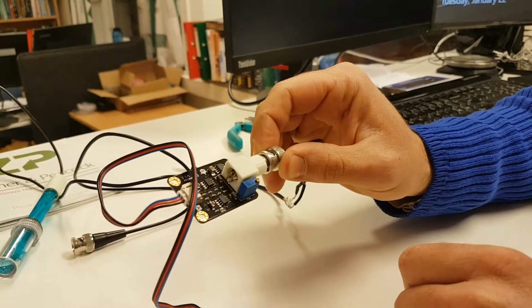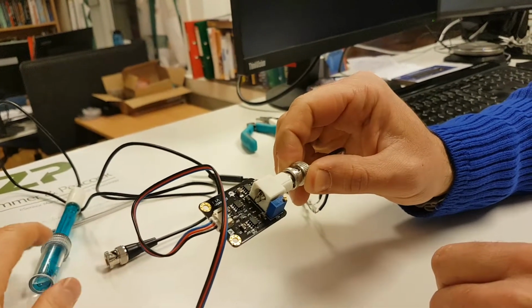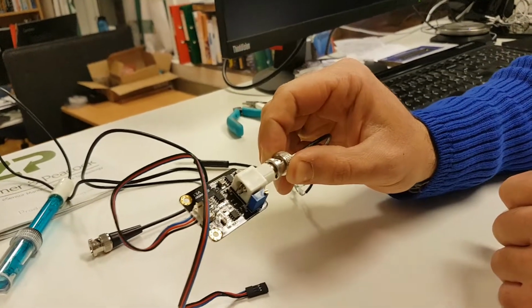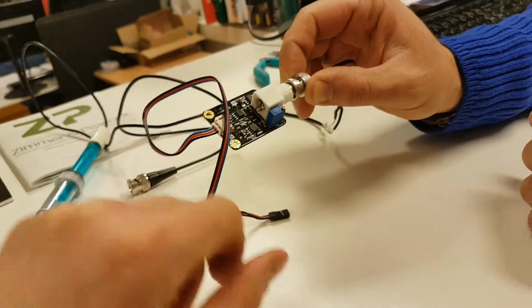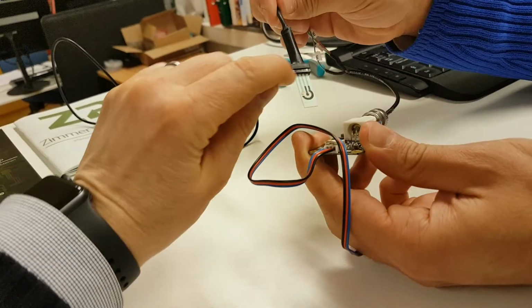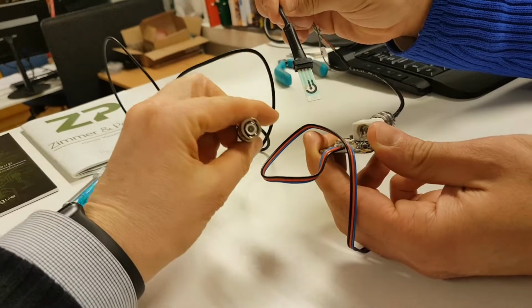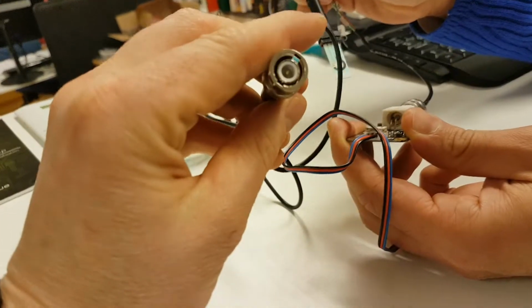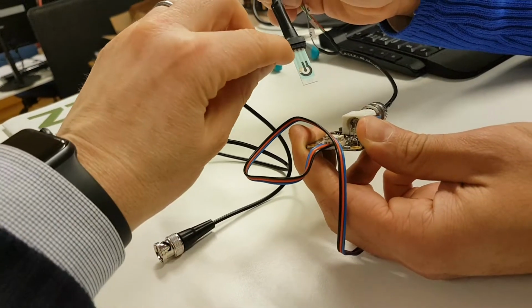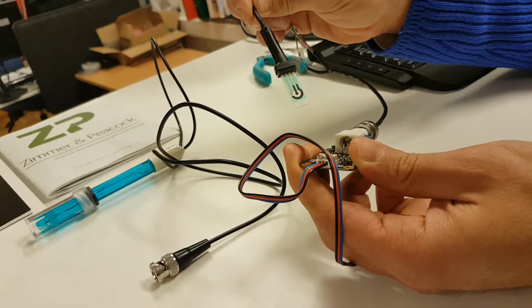Right, so if people have a probe and they have the BNC like this, we're not asking anyone to actually cut their gravity pH sensor off, because you can source them otherwise. But it's important that the working electrode, this central electrode, has to be connected to the central pin of the BNC. When we look at a BNC, there's a central pin, and then around the BNC there's an extra ring, and effectively you've shorted this and this through the cable to that ring.